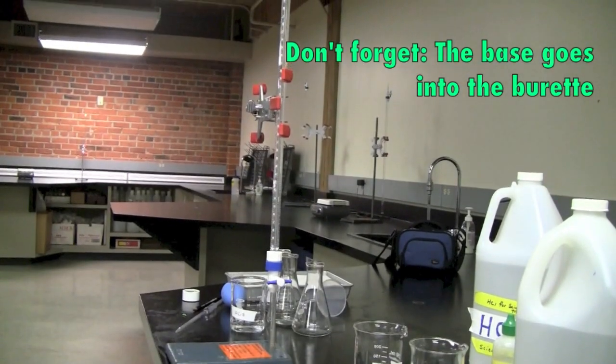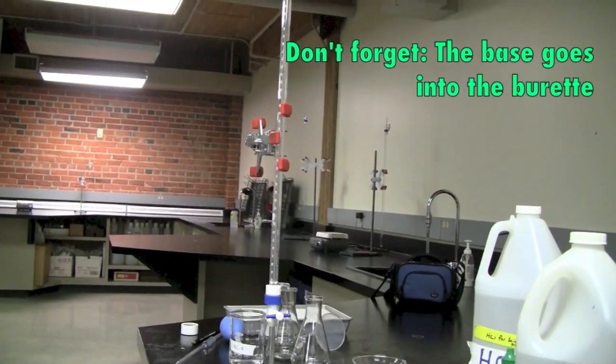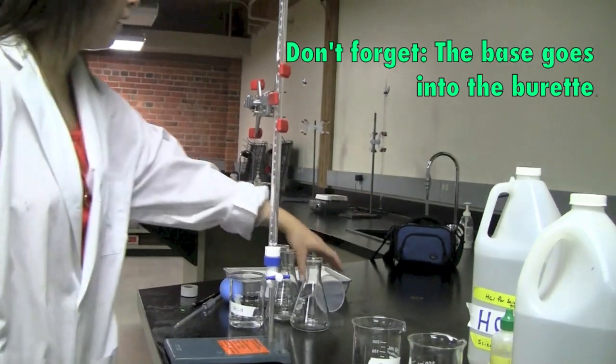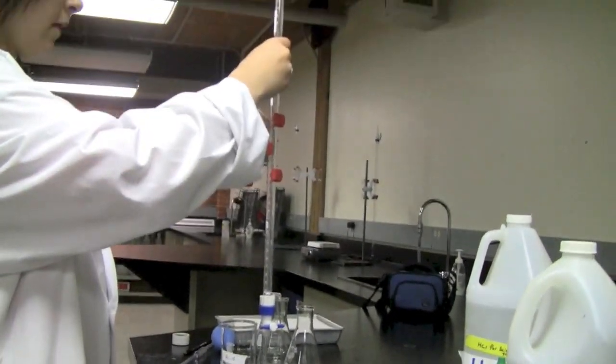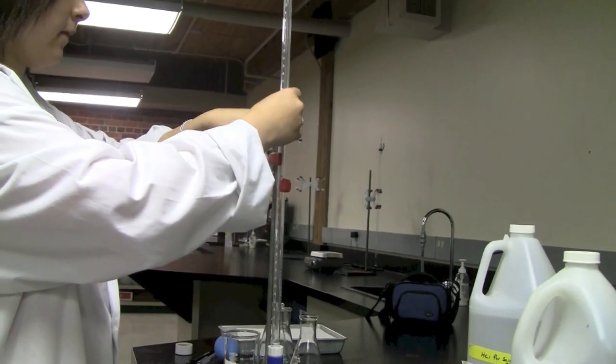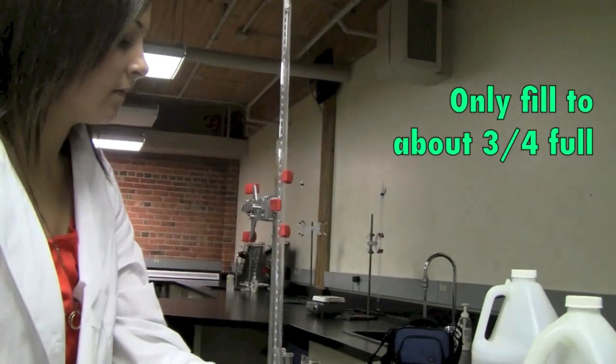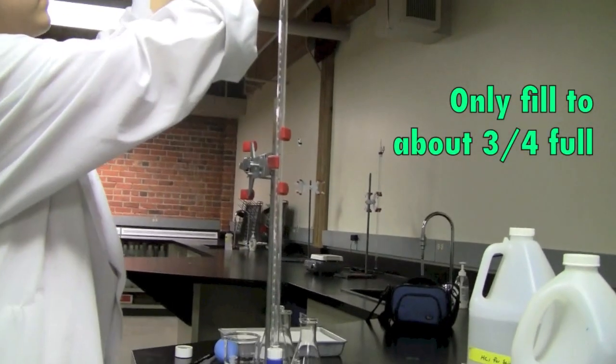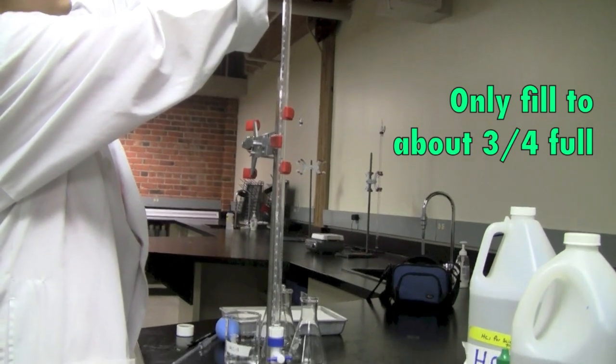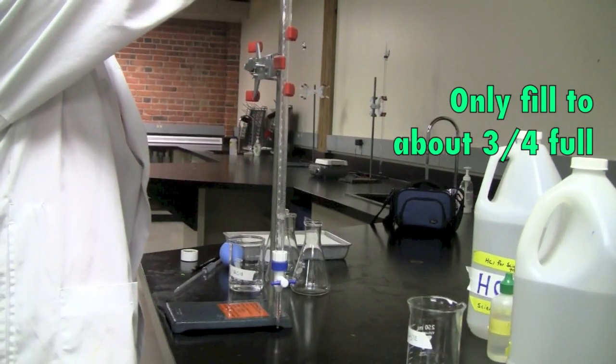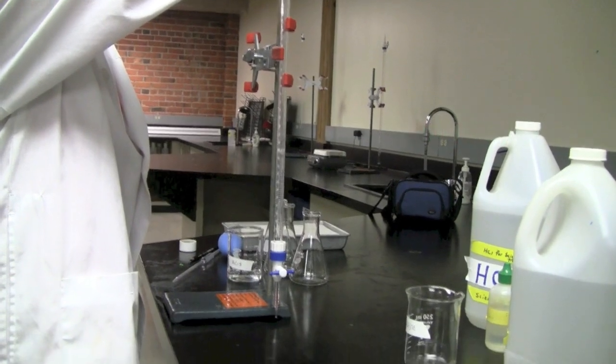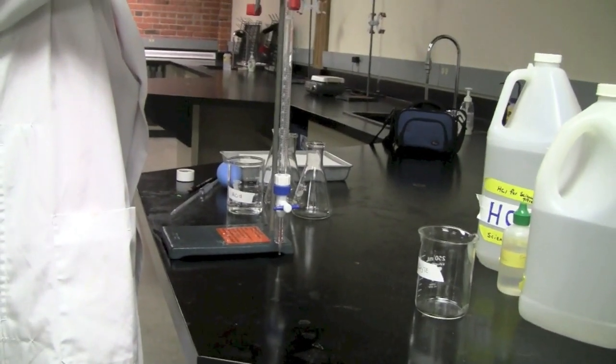So again, you will want to refill your burette with sodium hydroxide. Remember again to use the funnel. And there isn't a need to fill it up to the zero mark. You can just fill it up three quarters full. Again, make sure your burette is at a closed position.